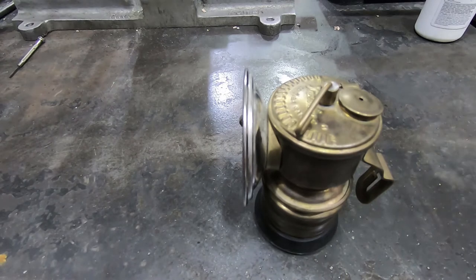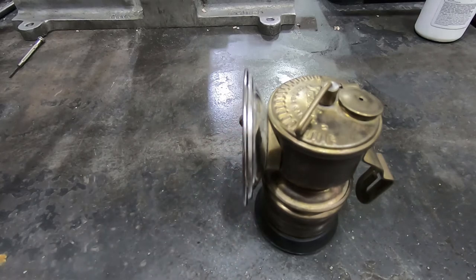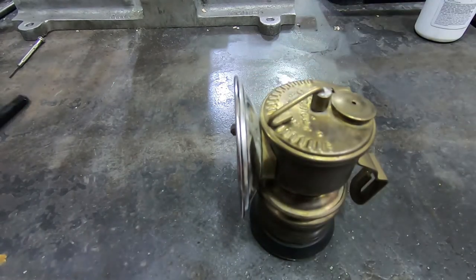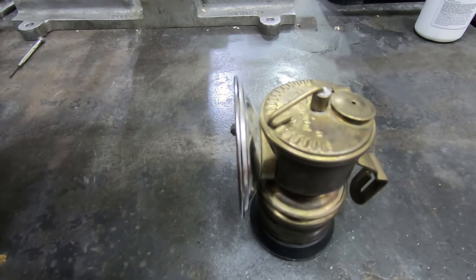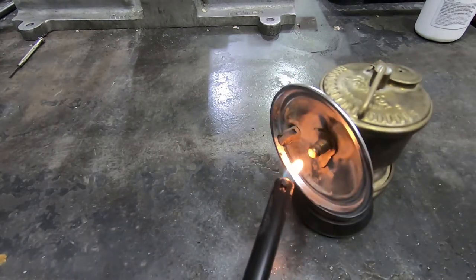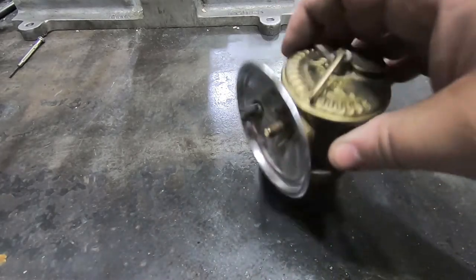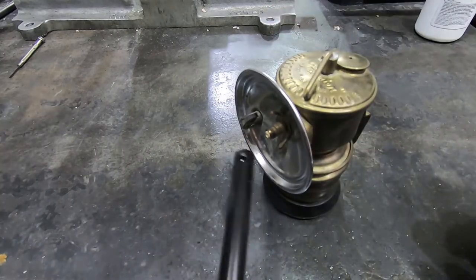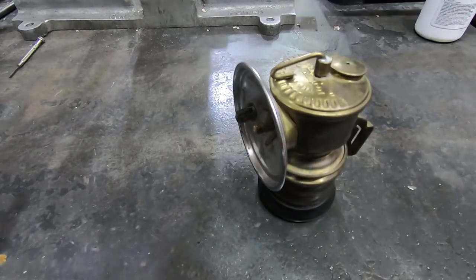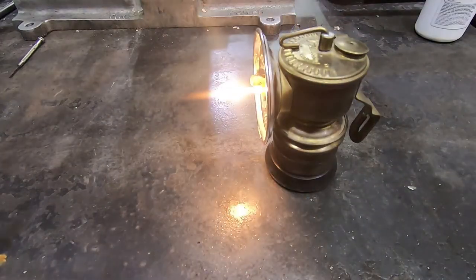I can't tell if I hear anything yet. Nothing there. I'll turn up the flow of water just a little bit. I realize since I only put a couple of chunks in there, maybe it's not contacting the water. Let's really douse it — oh, now I hear it bubbling. Oh, there it goes!